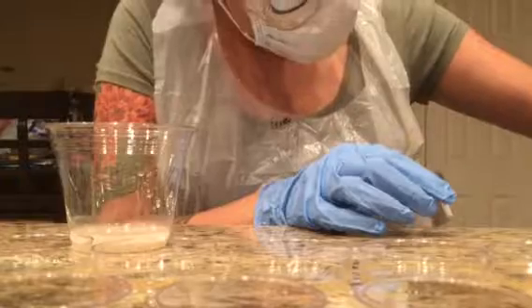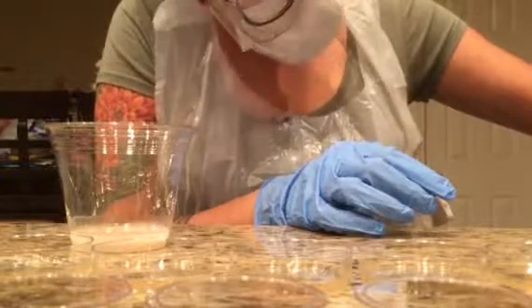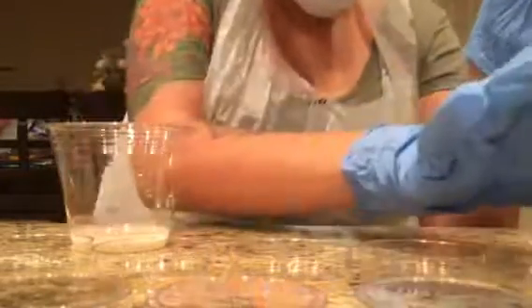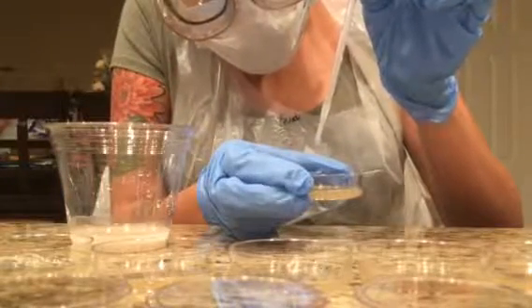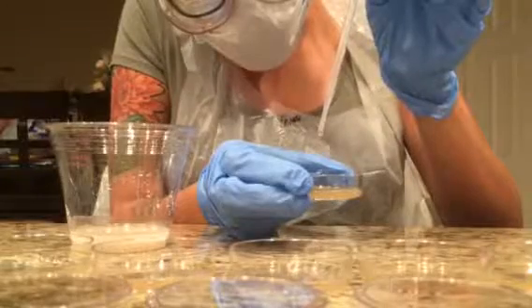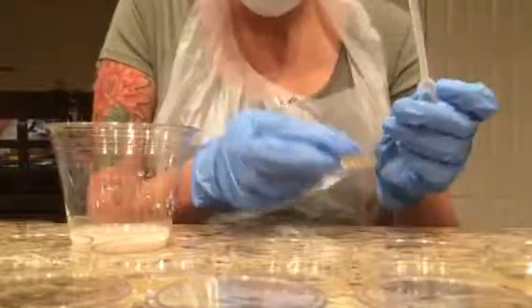So let me go ahead and give you an example of just one plate, just so you can see. So again, only 4 drops. Here's 1, 2, 3, 4. Okay.